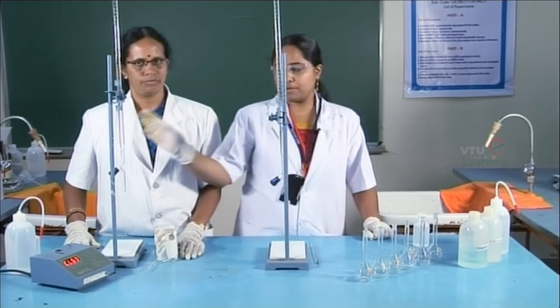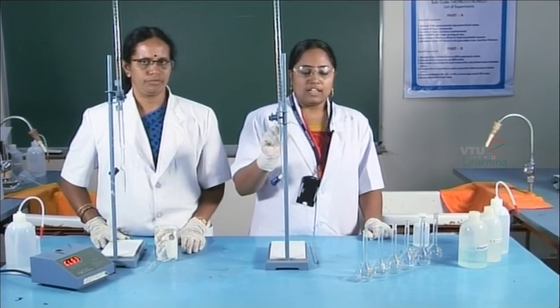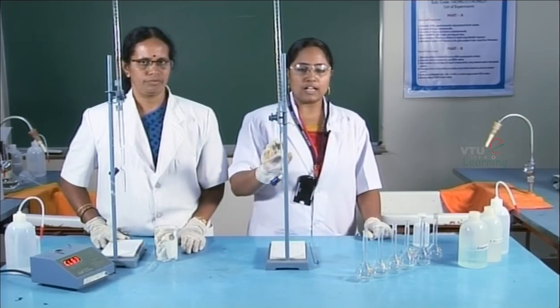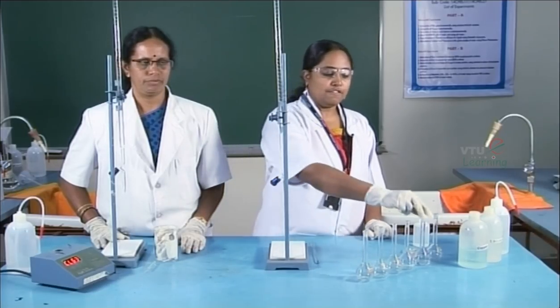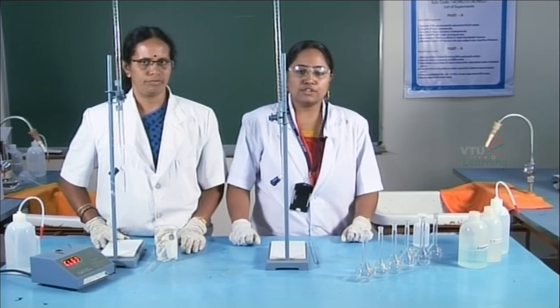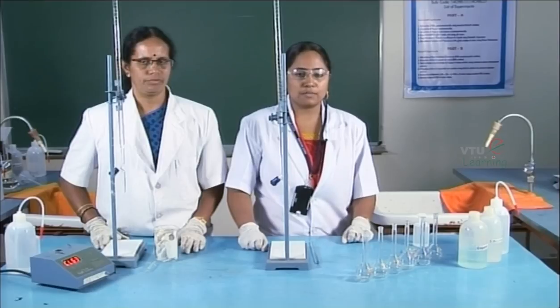In these two burettes, we have already filled copper sulfate and 1:1 ammonia solution. In the first four standard flasks, 5, 10, 15, and 20 ml of copper sulfate solution has to be added respectively. In the fifth standard flask, test solution is taken, and the sixth standard flask is used for blank solution preparation. For all the standard flasks, 5 ml of 1:1 ammonia solution has to be added.